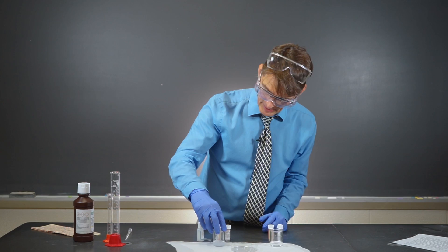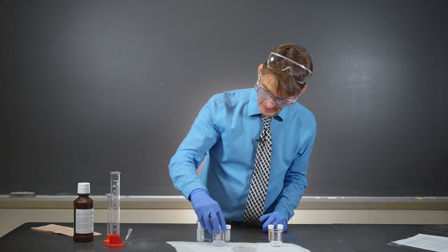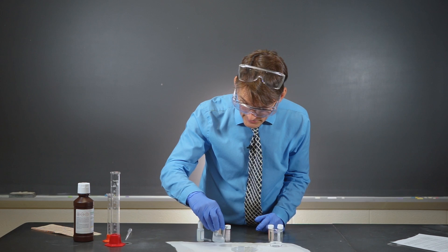We're going to get these dissolved. I've also added a little bit of hydrogen peroxide to this beaker over here. So you can tell I've mixed a lot of stuff together. And then we're going to see if this works. I hope it does.